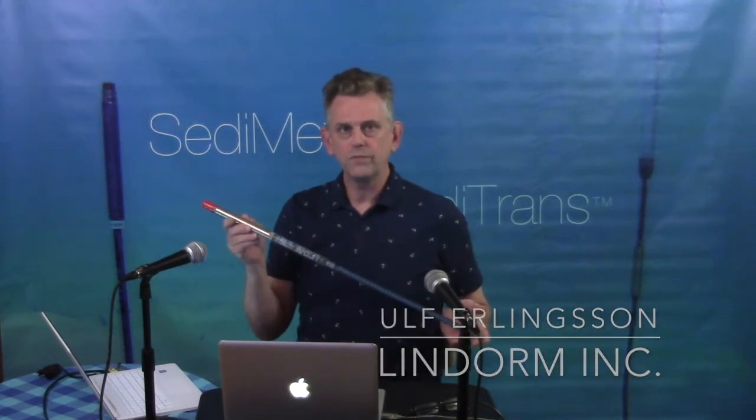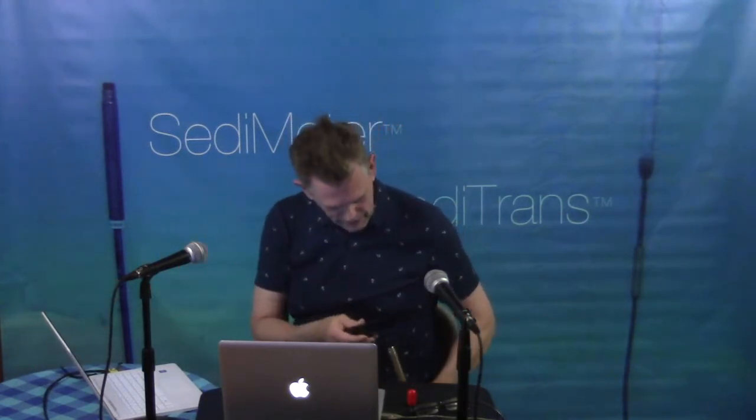Today I will talk to you about the SediMeter SM4 and show you the basics of how to use it. In this end we have the underwater pluggable connector. So I will connect the cable here, make sure it's greased, and as you see here there is a blue LED that turns on to show that power is connected, and the green one shows the battery is charged. Next thing we need to do is to open the software.